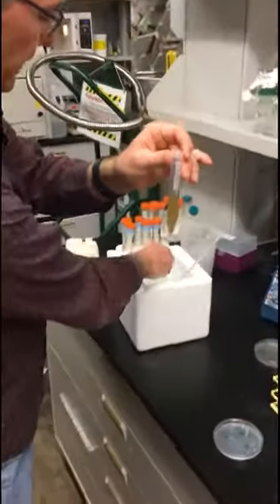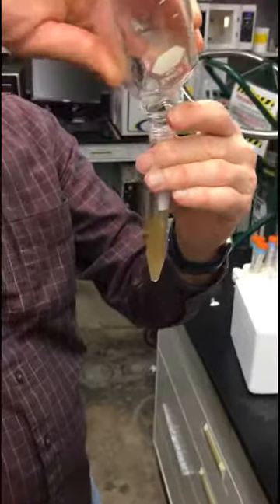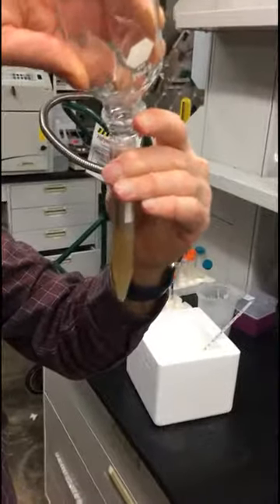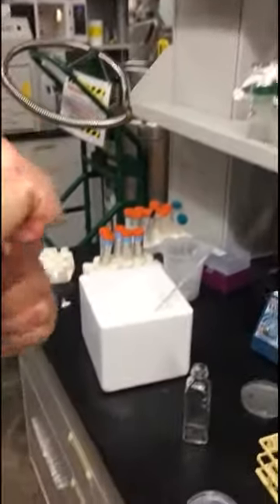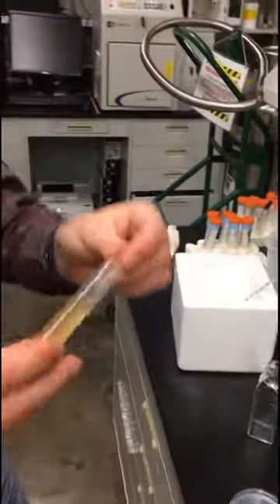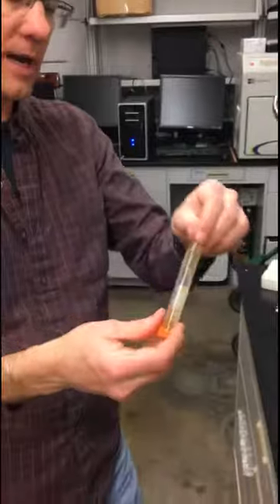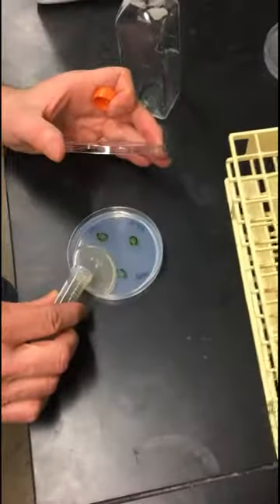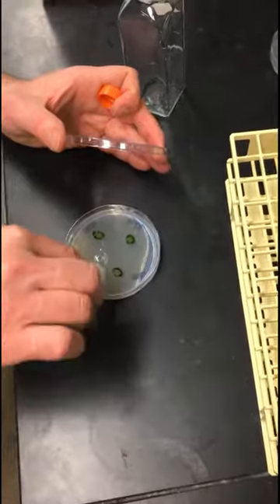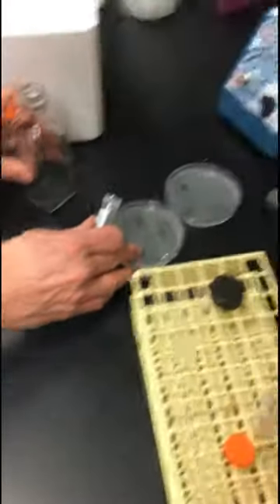I've already poured about 6 milliliters of my sensor culture into another tube for the second overlay. Now I'm going to pour the top agar in — it's a little bit cooler now, so we have to act quickly. We're going to use every little bit of it, though it's got a little bit less than I thought. Mix this well; hopefully the agar will still be high enough concentration to set — it might be a little bit more liquid than usual, but it should be okay. Pour it out; make sure it all gets poured. As long as that bit of agar is in the area with no cells, it's going to be okay — and there we go.